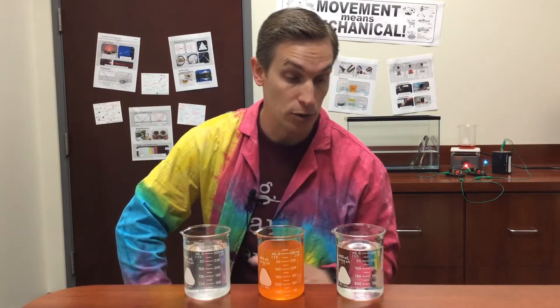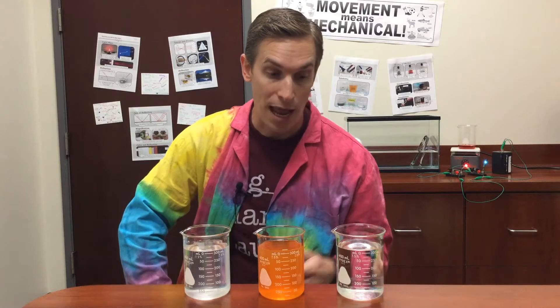Here I have three solutions that I made by dissolving salt, sugar, and powdered sports drink into three beakers of water, but those solutions got mixed up. Now I need to determine which is salt water, which is sugar water, and which is the sports drink. I could just taste them, but I'm never supposed to eat or drink anything in the lab, and especially not out of beakers, so that won't work.